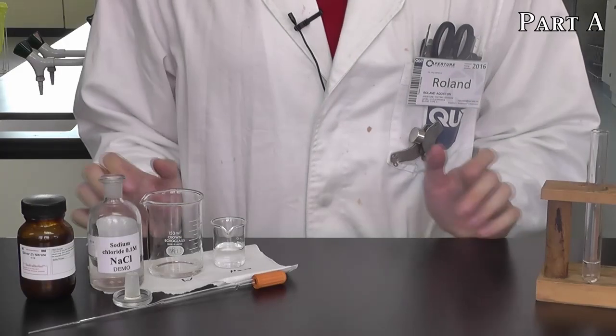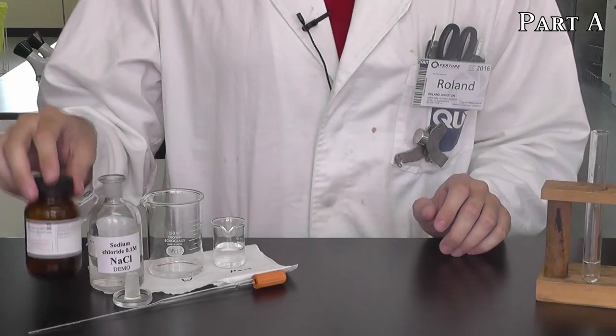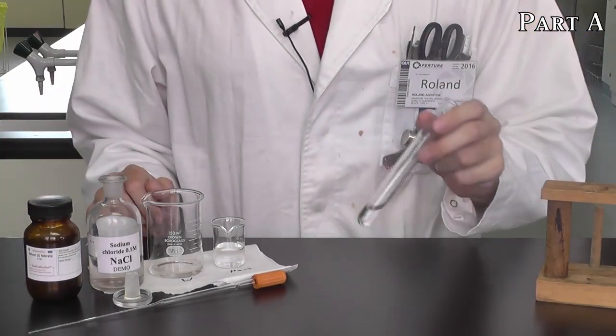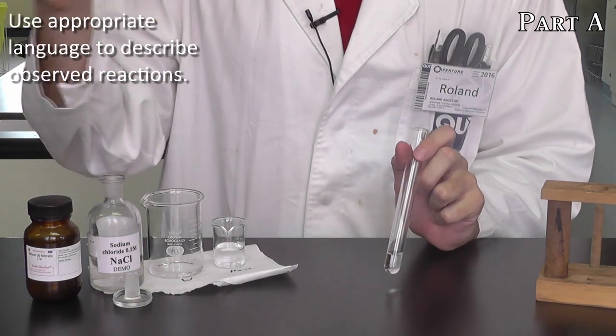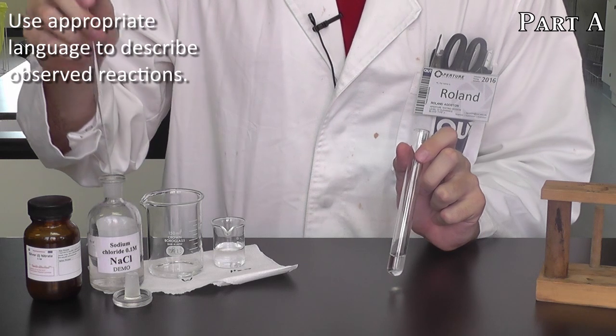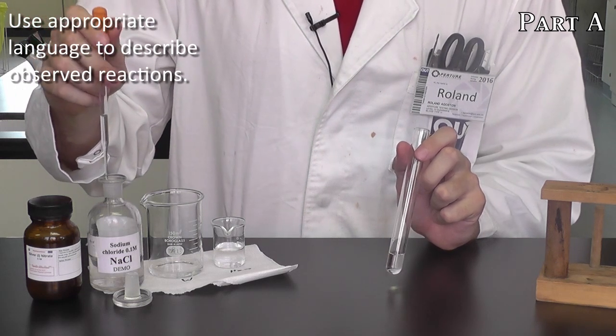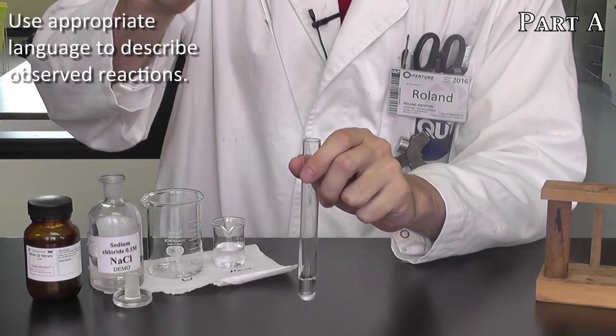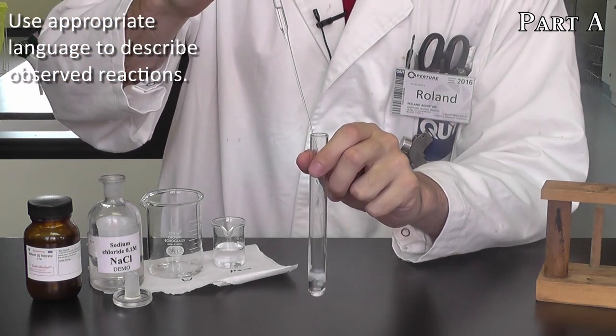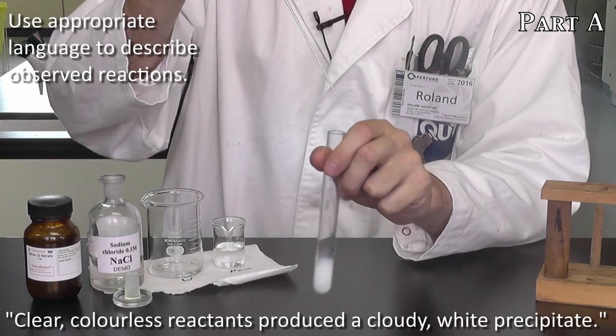We'll first step you through an example and then we'll look at some of the theory behind how you can predict a precipitate forming. In this example reaction, we have some silver nitrate, which I've poured about 2 mLs of into this test tube. You can see it's colorless and clear. And what I'll do is I'll take my pipette, and from my working stock solution, I will dispense about 1 mL of sodium chloride into it. You can see it's also clear when we start, and by mixing the two, you should see a pretty rapid reaction.